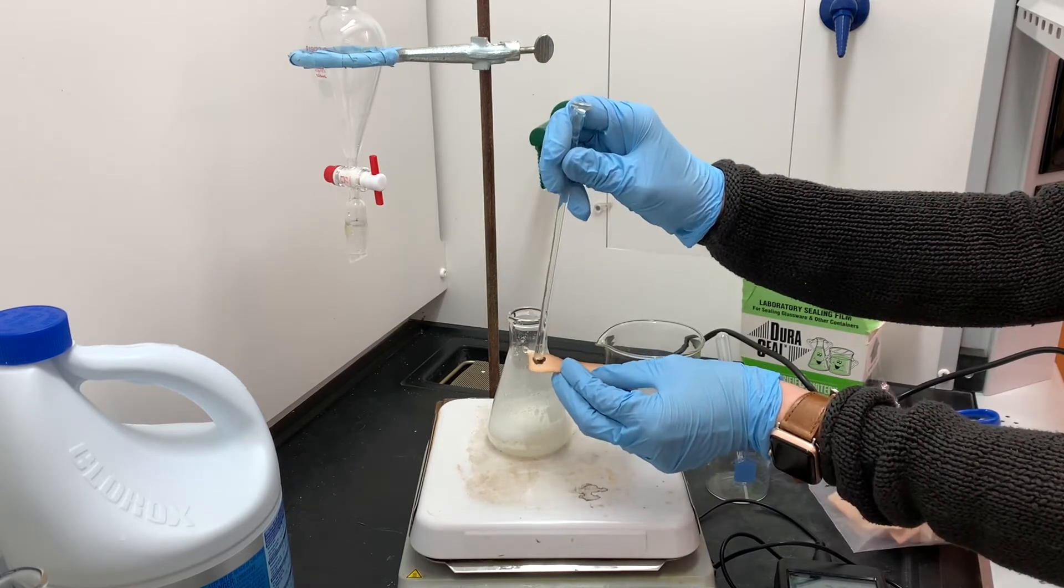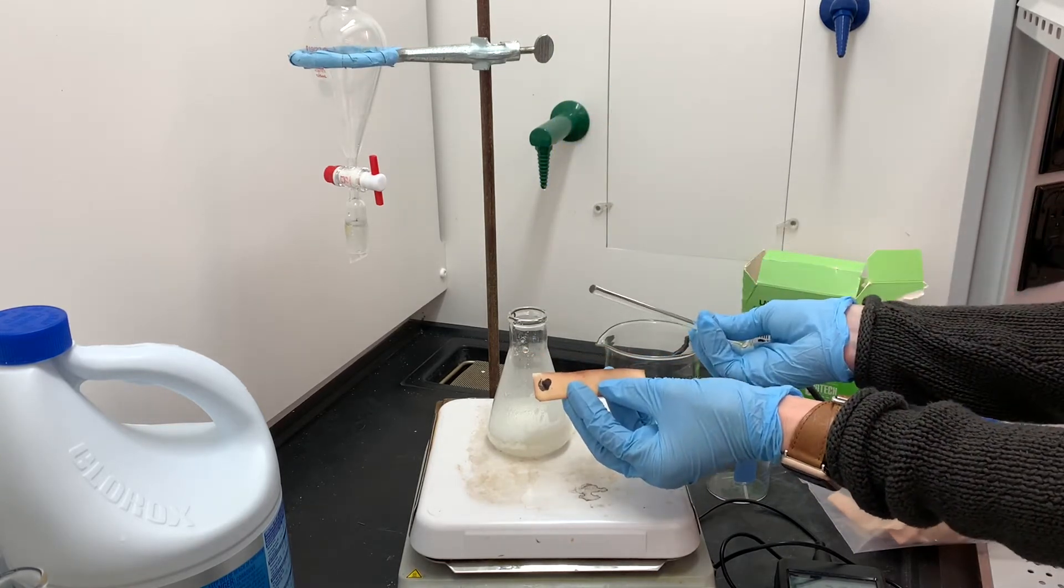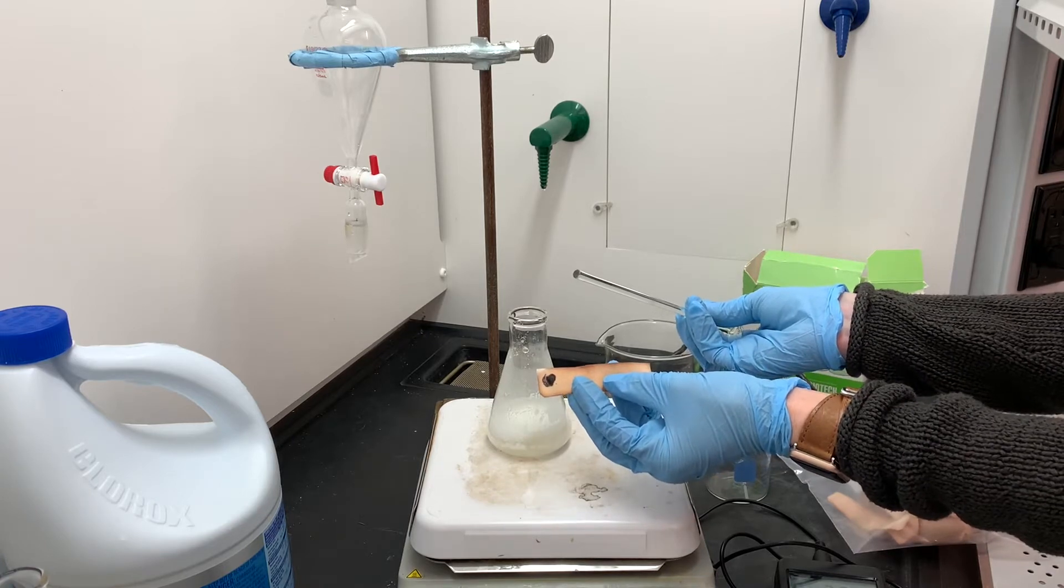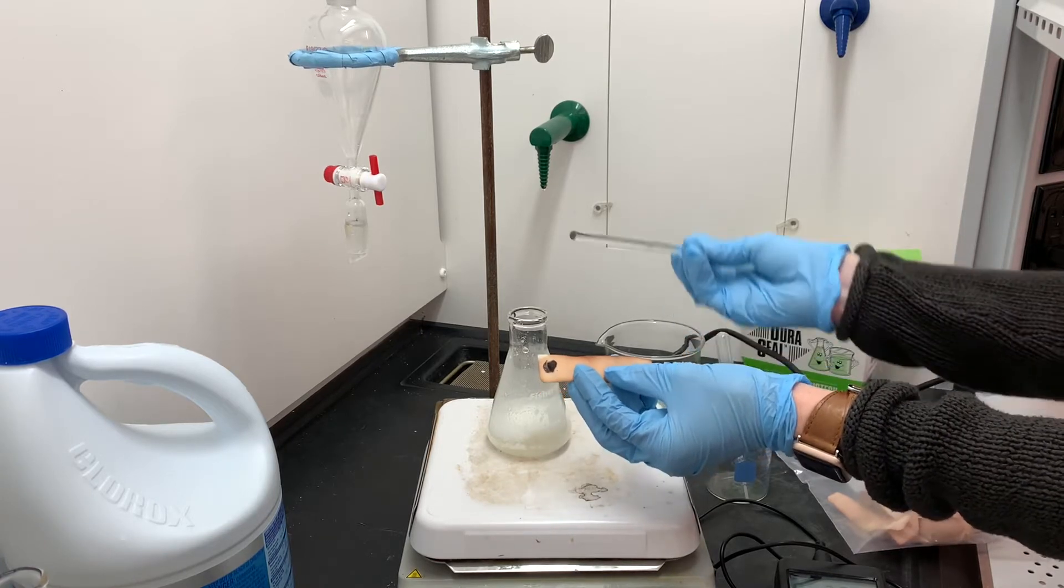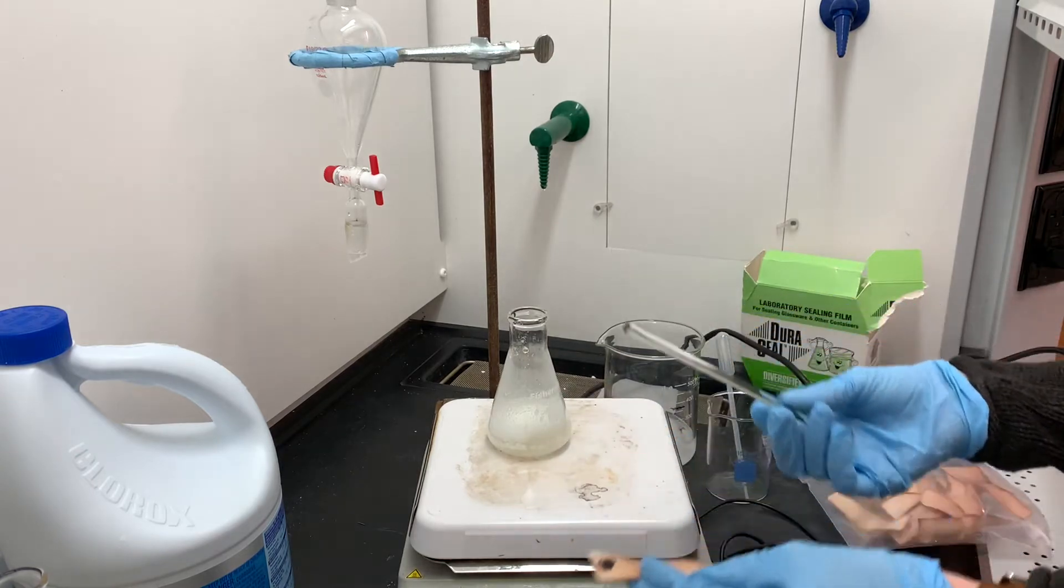Through the next 30 minutes I'm going to be testing with starch iodide paper just to make sure that I have plenty of bleach present. If I don't have enough bleach present, then I can just add a little bit more. I just want to make sure that I don't run out.